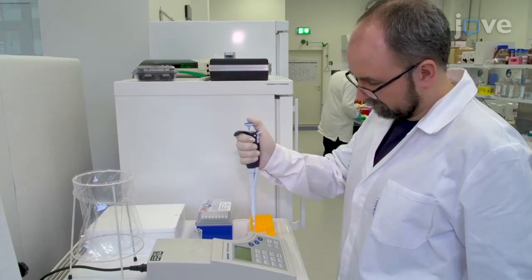Determine the protein concentration using the Bradford protein assay or another appropriate one.